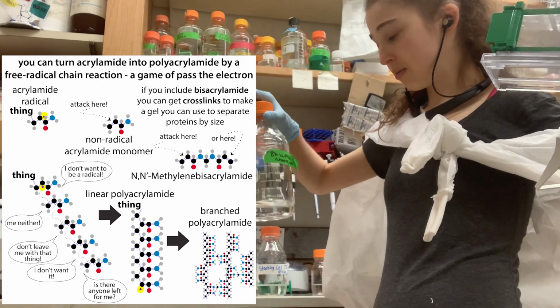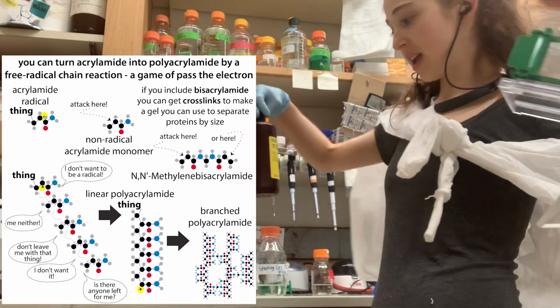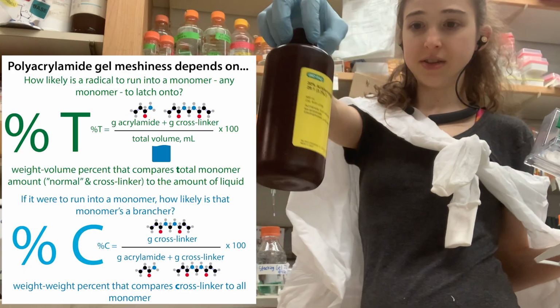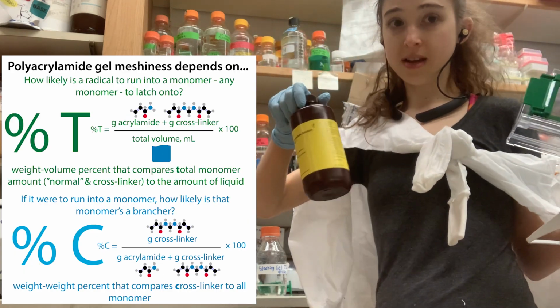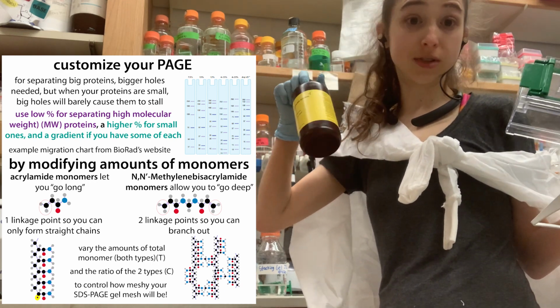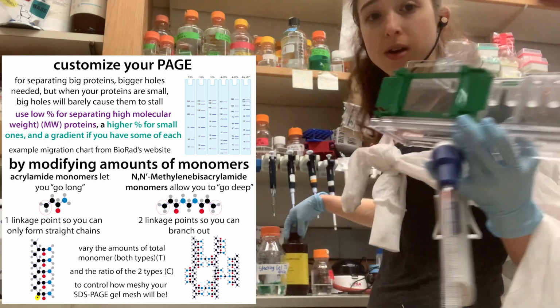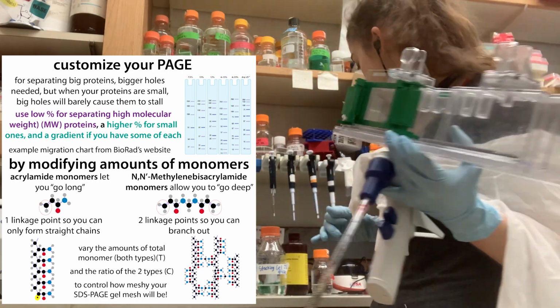So I'll talk about how we do it, then I'll show you how we do it, and then I'll talk about what's actually going on. So we have master mixes that we make, which have buffer, a pH stabilizing agent, and then acrylamide solution. And you can use different amounts to get a higher percentage for separating smaller things or a lower percentage for separating bigger things. And don't worry, I'll go into all this in more detail. I just wanted to give you a look at what it looks like first.